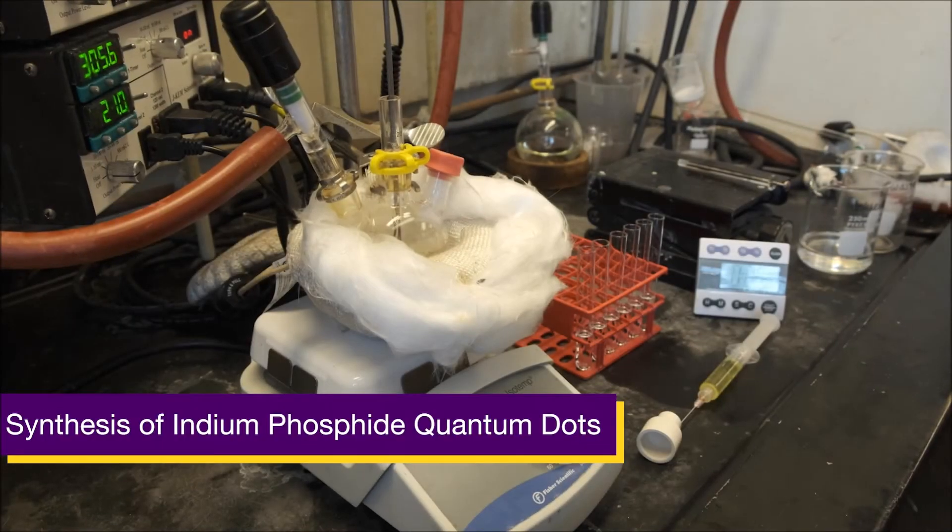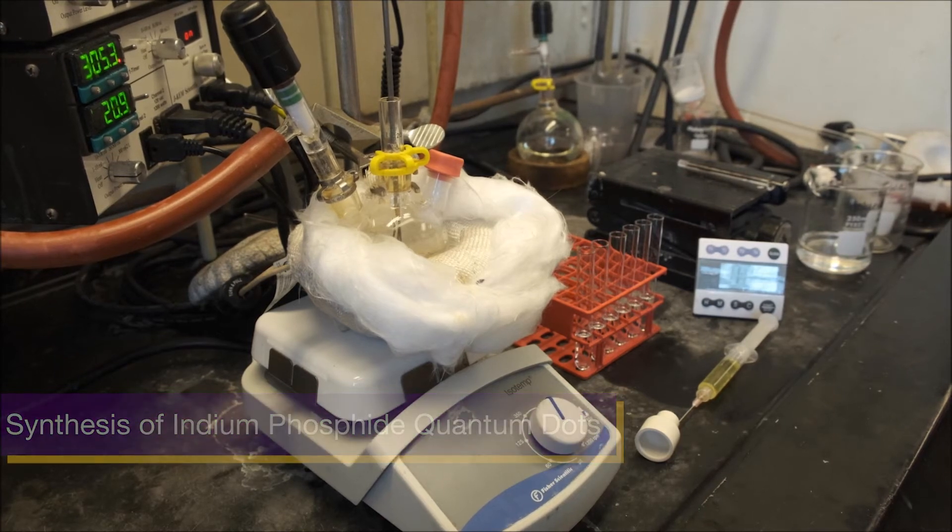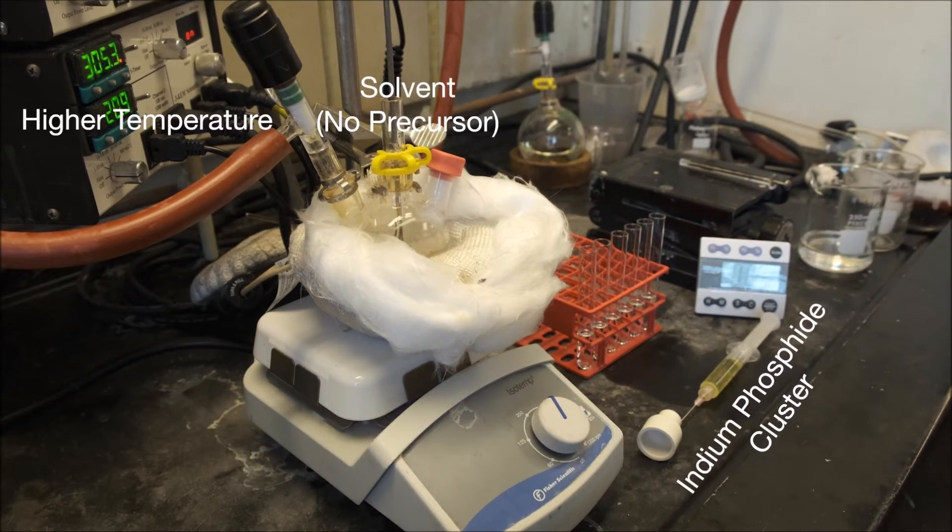Here we have a reaction setup for the synthesis of indium phosphide quantum dots, which has a few key differences compared to cadmium selenide. One is that we're operating at a high temperature of about 300 degrees Celsius. Secondly, it is critical that the synthesis is carried out in rigorously air and water-free conditions.